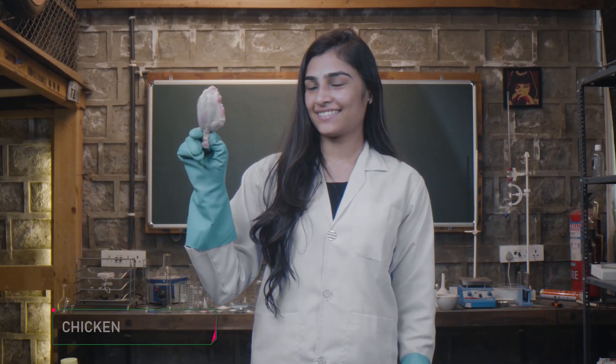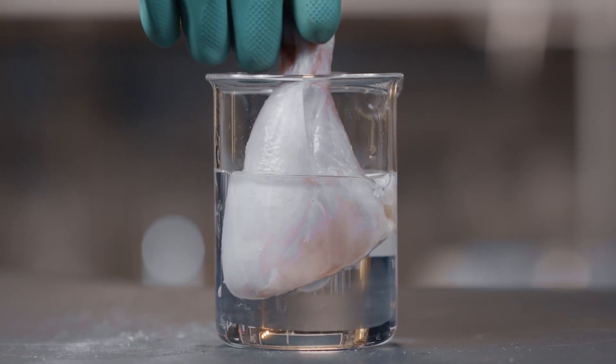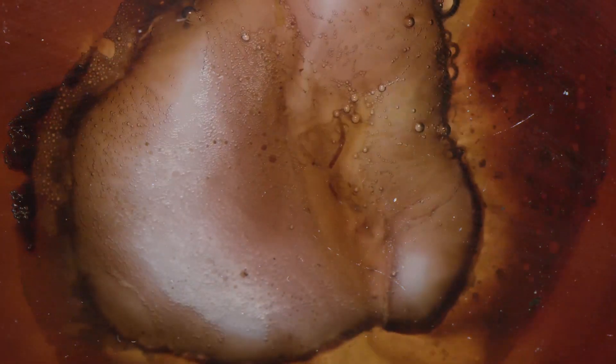Now run to the kitchen and grab a piece of chicken — chunky if you can — and dip that chunk in a beaker of sulfuric acid and watch it waste away.